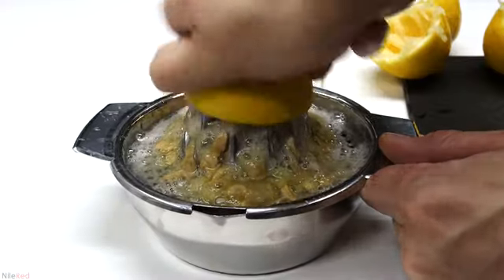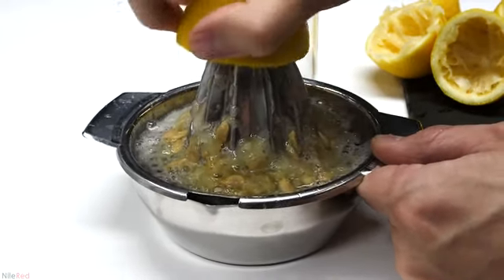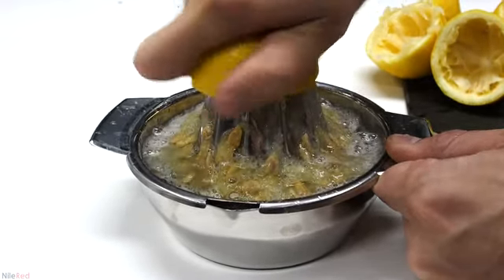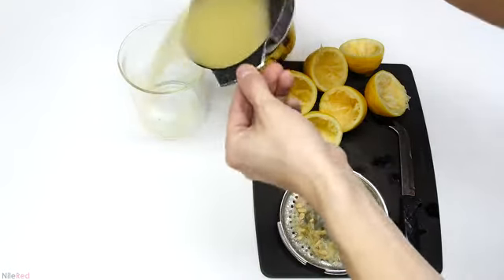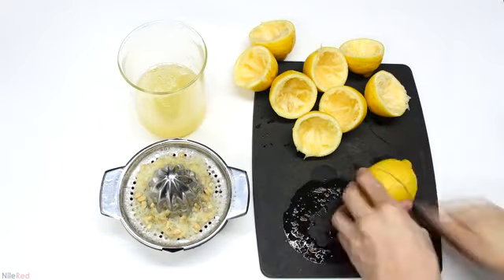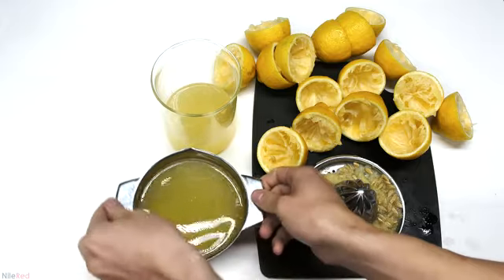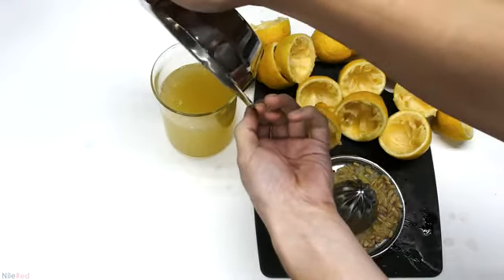The first step is to remove the juice from all of the lemons. I did this manually by chopping each lemon in half and then juicing it like you see here, but there might be an automated way to do this. I removed the juice from about 4 lemons, and at this point my juicer was full, so I had to empty it into a beaker. I then continued things by chopping up and juicing the rest of the lemons. Once they'd all been processed, I transferred the juice to the beaker.